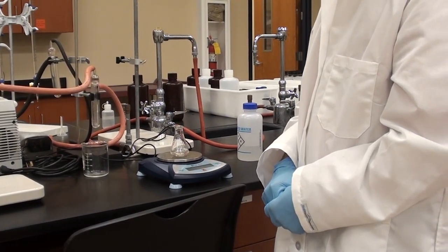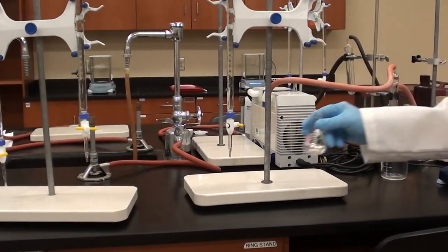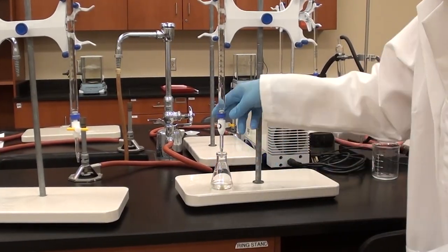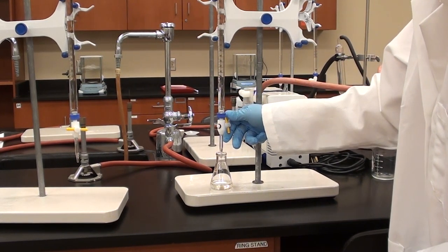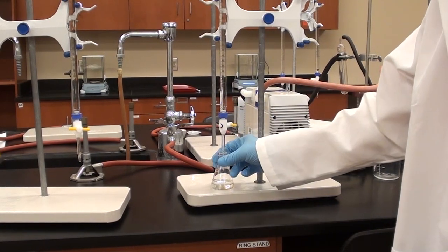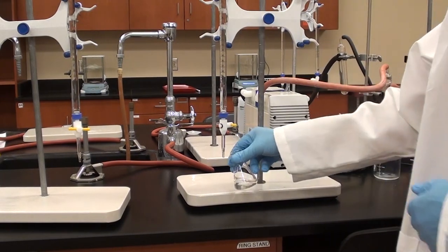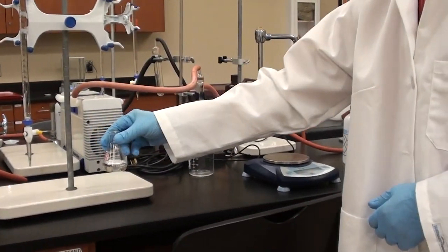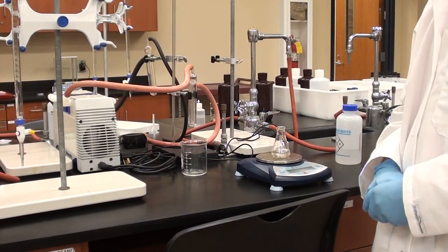All right, let's go ahead and put it back. We'll do one more here. This is the fourth one. So we're going to take it down to about 24, 25, something like that. Good enough. And, of course, you'll be recording this accurately at this point. Yeah, you'll record it, whatever it is, to two decimal places every single time. And then we'll weigh it again. Notice I did not tare the balance in between.